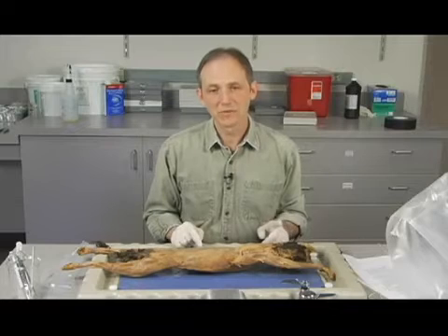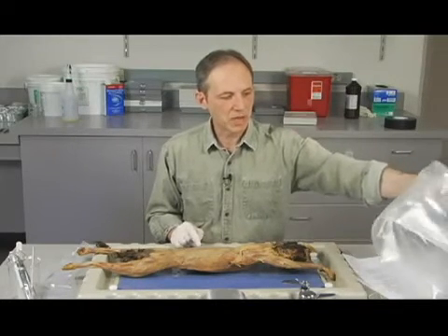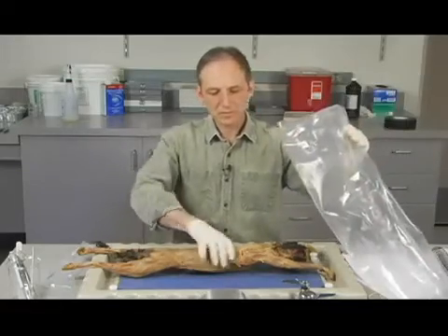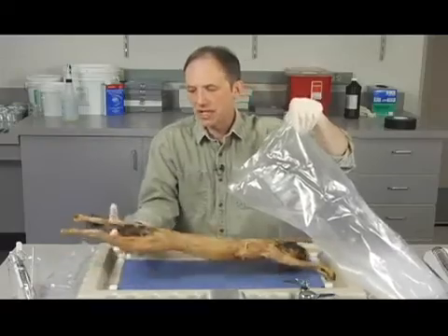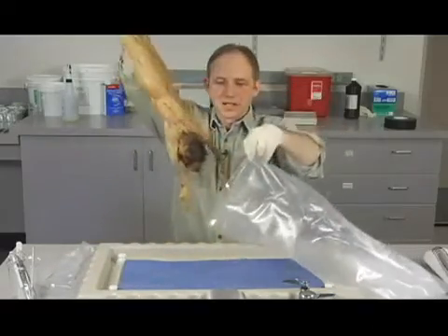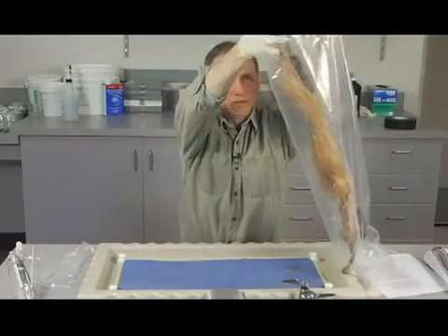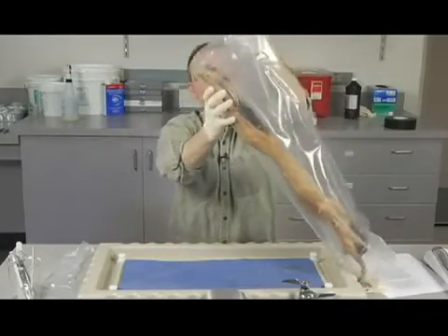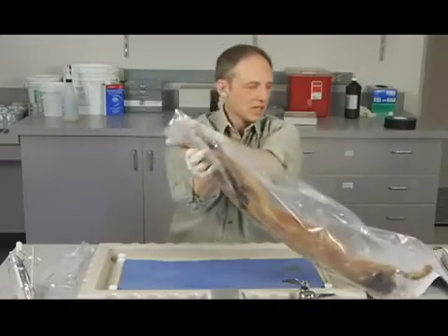Keep in mind, again, we have 2 bags that we're going to be working with. I've kept my bag close by here, so it's right here. You hold it open, lift the cat, again, sort of from the feet, and see if I can get this in there. Fairly smooth. And we've got the cat back in this bag.